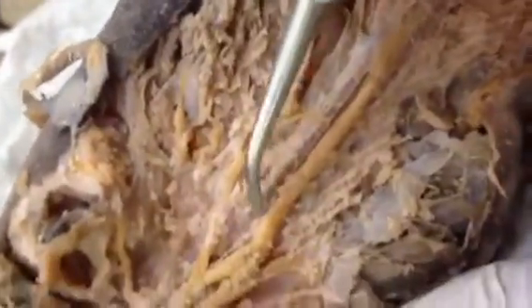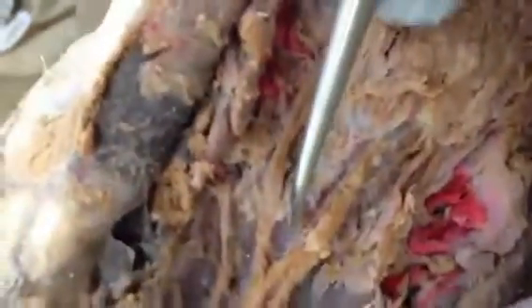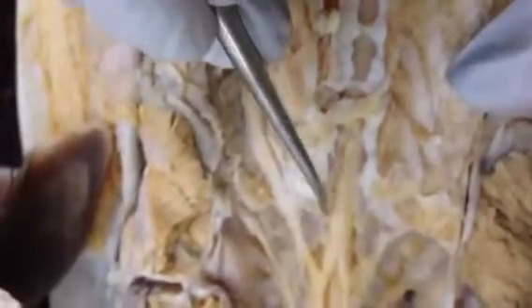Occipital nerve — occipital nerve is here. Or here. Okay. And spinal nerves? Spinal nerves are here — all the little ones. Okay, let me see on mine. Here is the spinal nerve. Okay. And here, the spinal nerves are here.